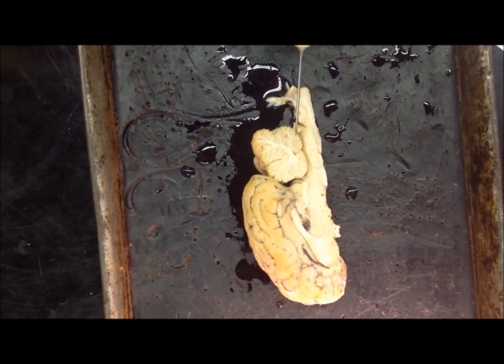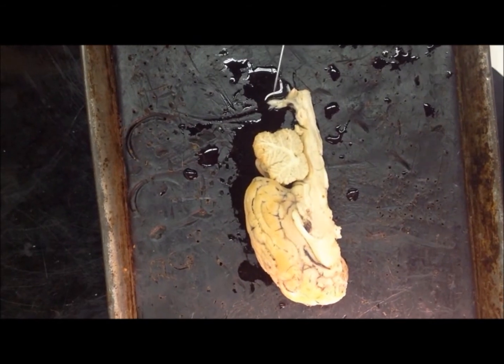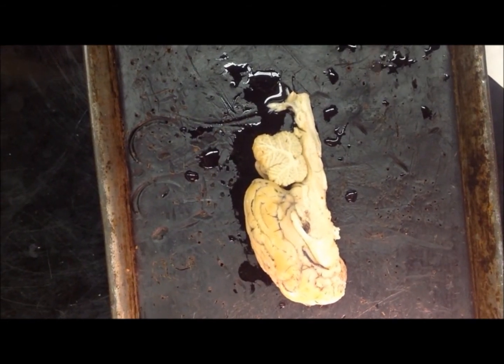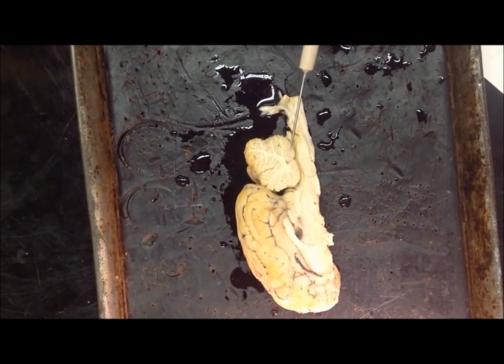We will now take a look at the cerebellum from the mid-sagittal view. The cerebellum lies at the posterior end of the brain. It has really nice cauliflower-like features. Now that's food for thought. The most ventral structure at the base is the lingula. Let's trace the cerebellum in a clockwise direction.